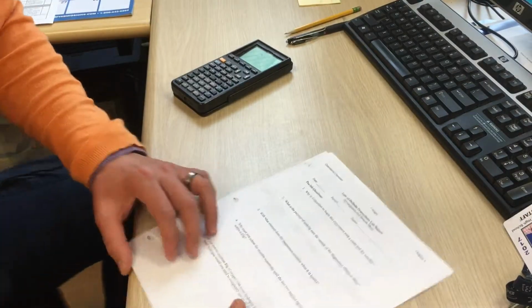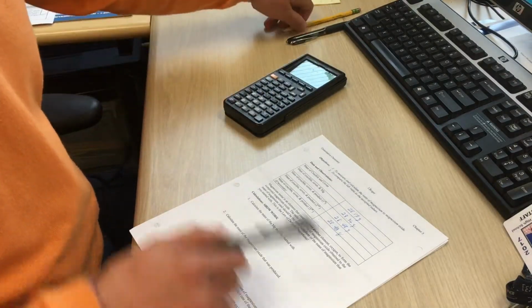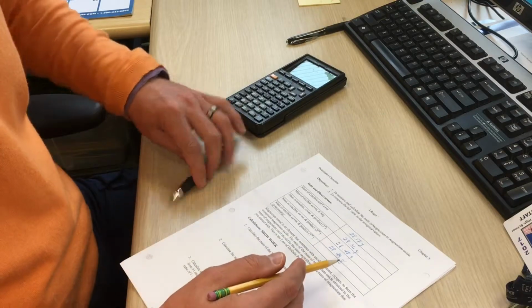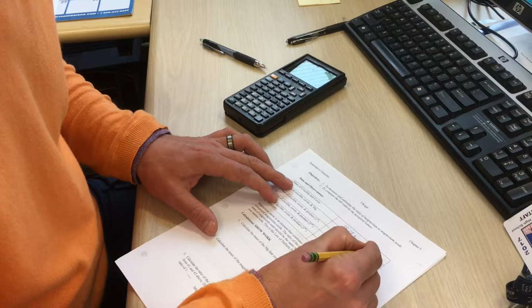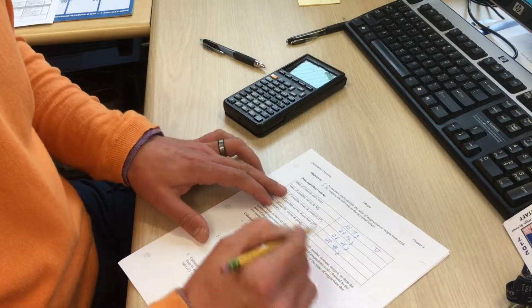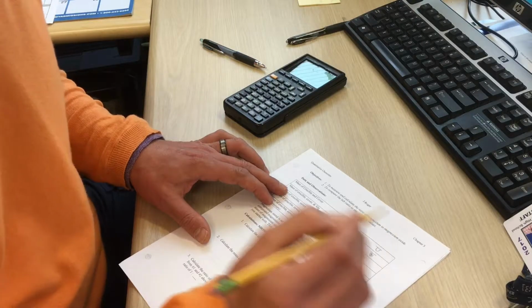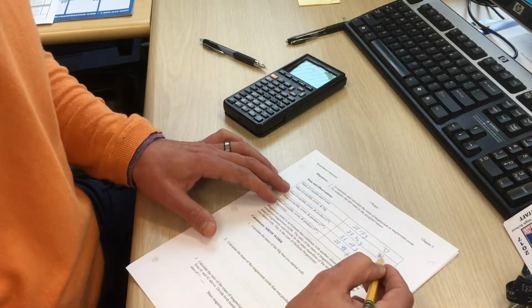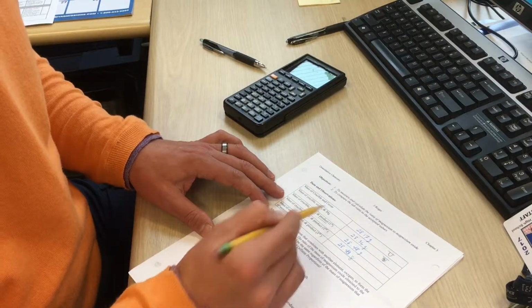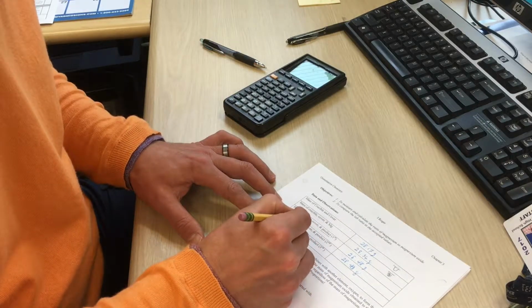Okay, so we're going to work out some problems on our law of definite composition. First, the data we collected: the mass of the crucible and cover, our little crucible and the cover with nothing in it. Then we took the mass of the crucible, the cover, and the piece of magnesium in there, before we started the reaction. Then after the reaction, we have the product, which in this case is magnesium oxide.